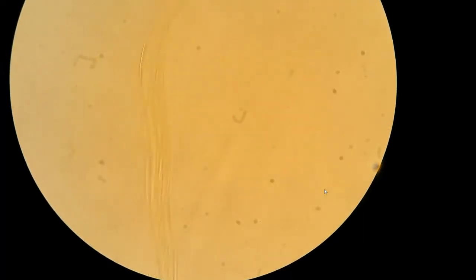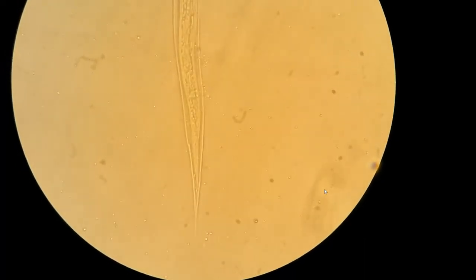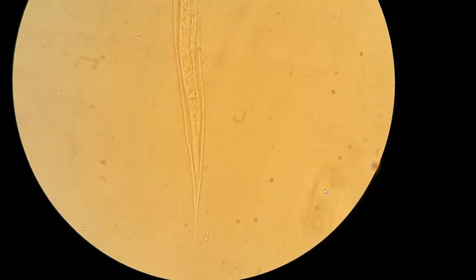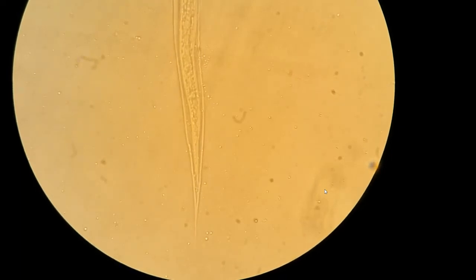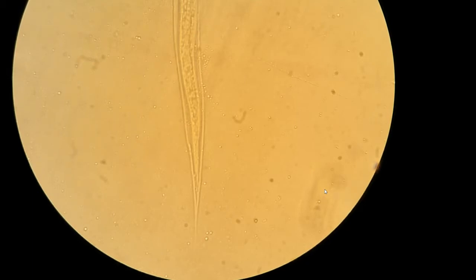Welcome everyone to the supplementary video of the hookworm lecture. This is Dr. Mara Romer. This video is to have a closer look at the third stage larva of the hookworms, the filariform larva.